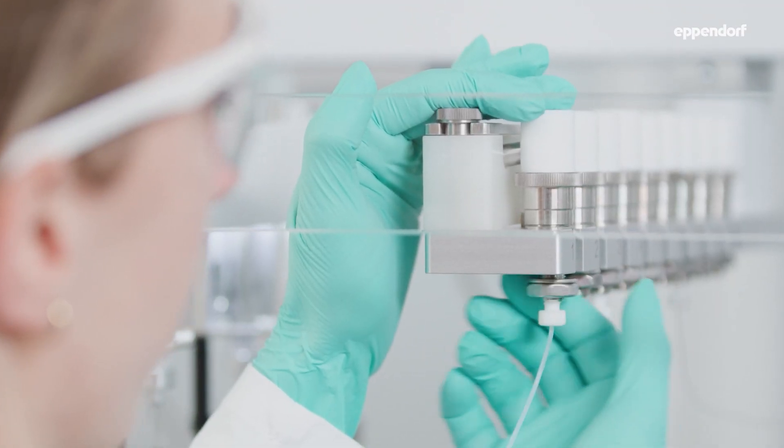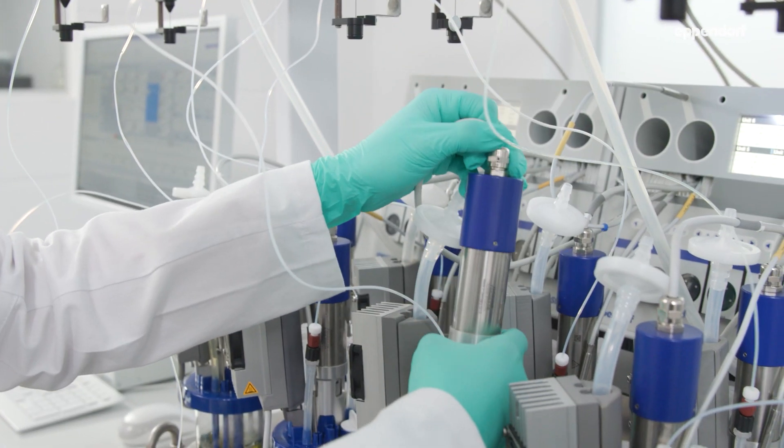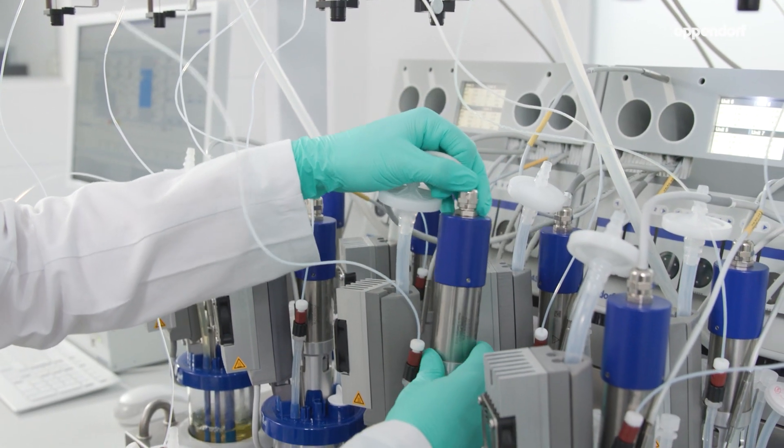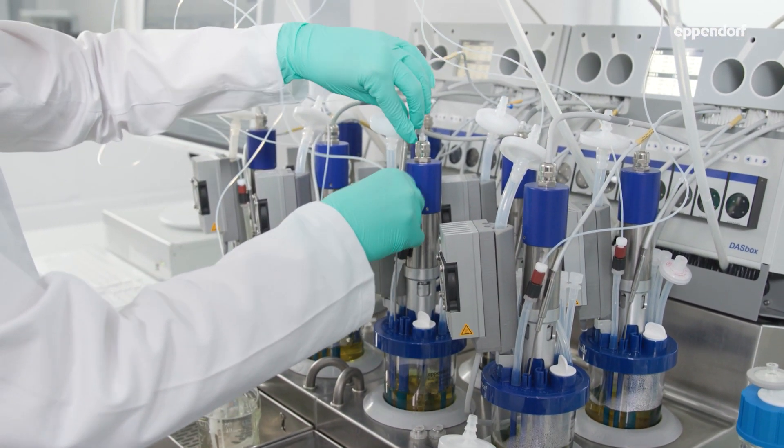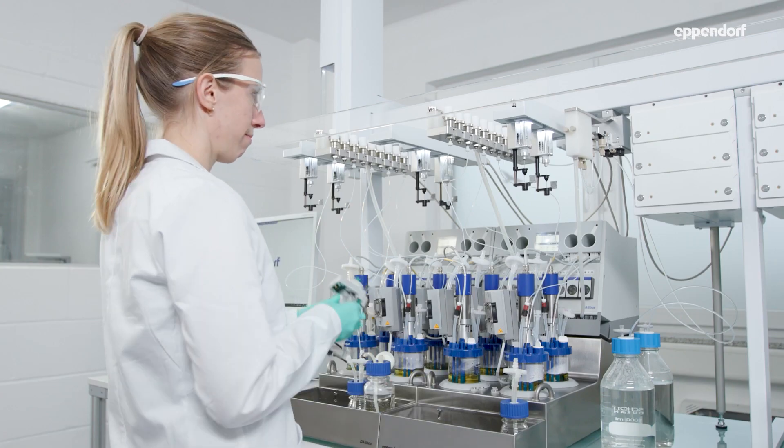The advantages of the Eppendorf AutoSampler are the compatibility with the Eppendorf Bioprocess Systems equipment. Additionally, it's fully integrated into DASWARE Control 6. You have predefined sampling schedules, which are still easy to adapt during your process. And the aseptic sampling mimics the standard sampling you would have in your lab.